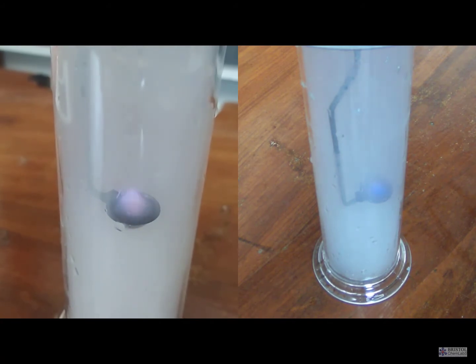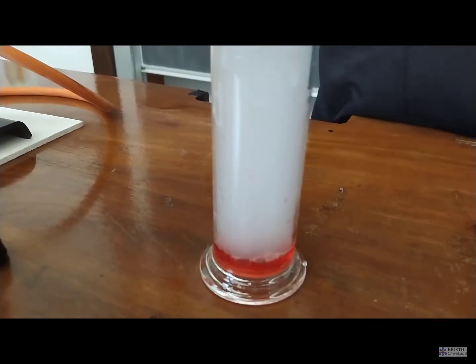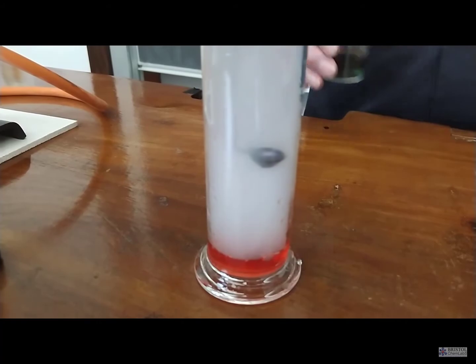As you can see in this demonstration, we've added a bit of universal indicator in water into the gas jar. We didn't even have to shake it up to show you that the sulfur dioxide fumes were acidic.